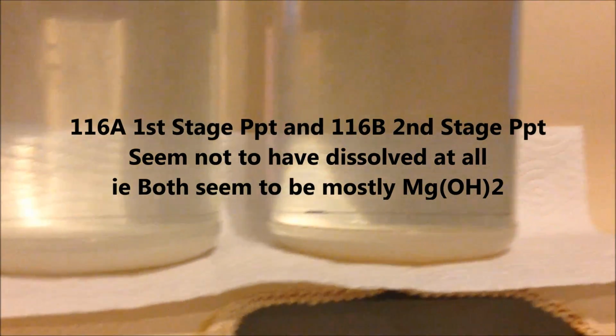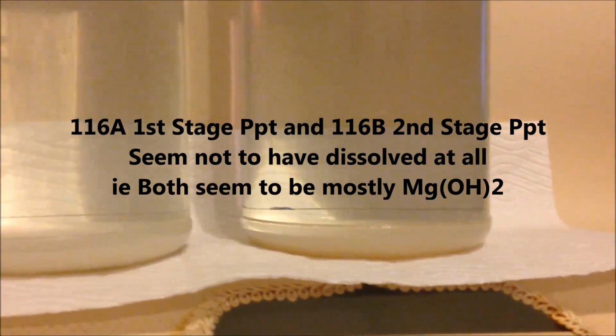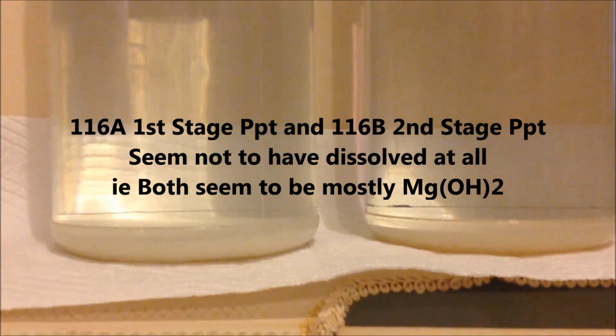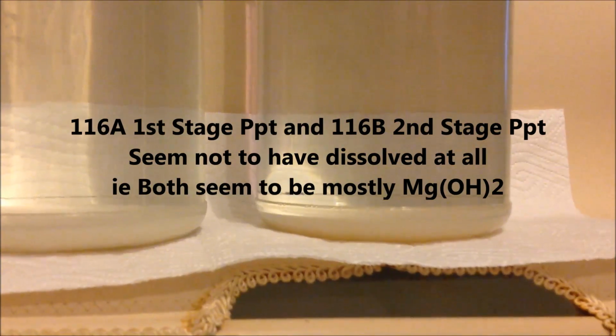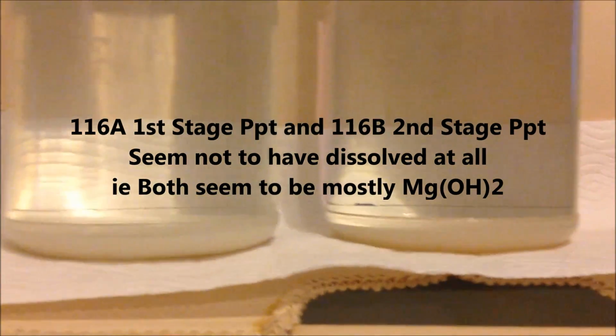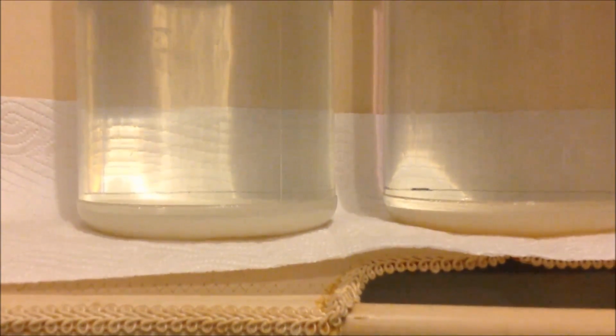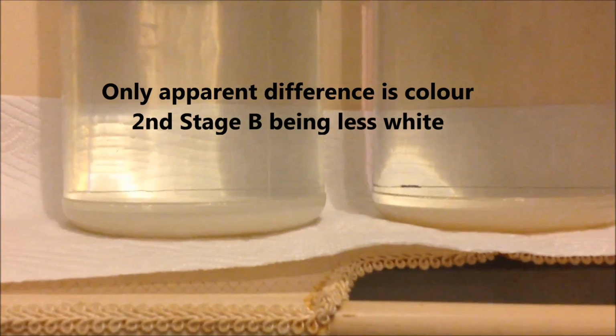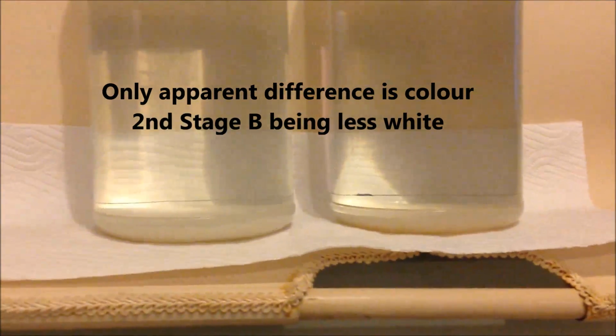Remember, that was in quite a small sample jar, so it looks to me like it's pretty much all still there, and certainly our purpose is to split the two, see if there's a difference between the two. It's not showing anything. The colour, B is still slightly more tan than A, so I think that hasn't changed either.